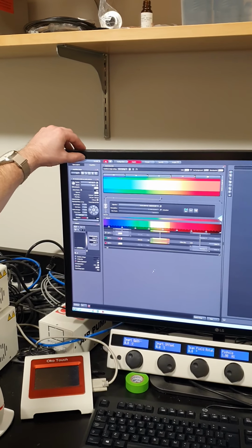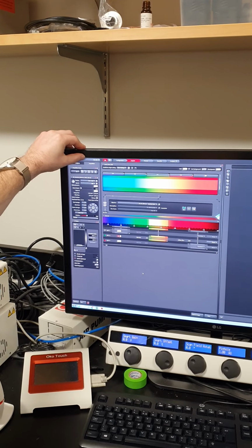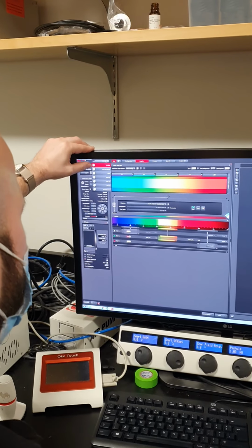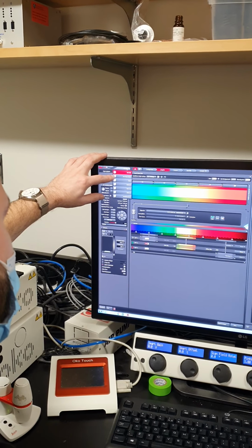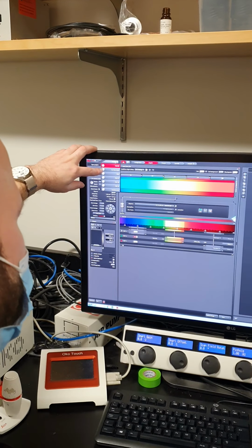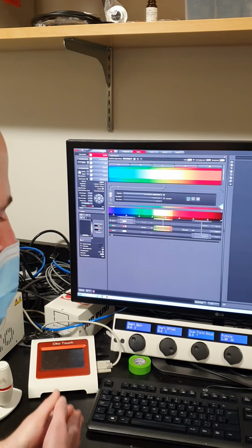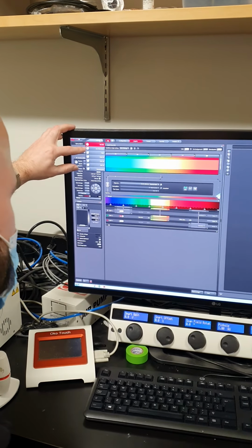And then this up here is where we choose what software module we're using. By default, it'll be this TCS SP8, and this is the core software. Then if you click on that, there are these other options. These are all specialized add-on packages that we bought for particular imaging types. So live data mode is for setting up complicated time-lapse experiments, where you want to do something more complicated than just taking the same type of image at a fixed interval. This lets you set up basically any sort of time-lapse.